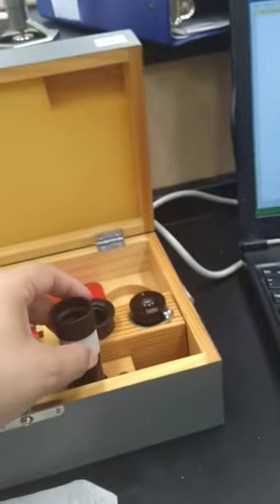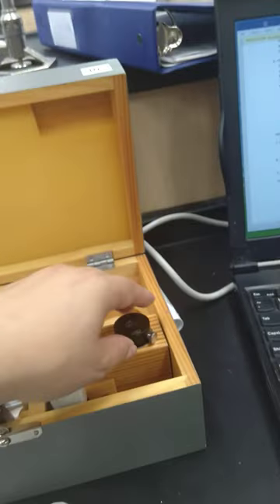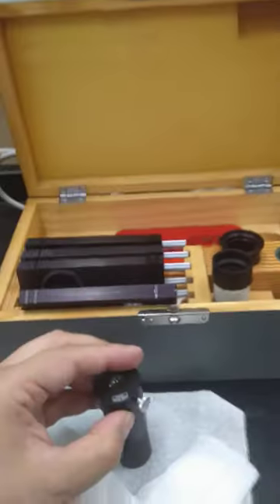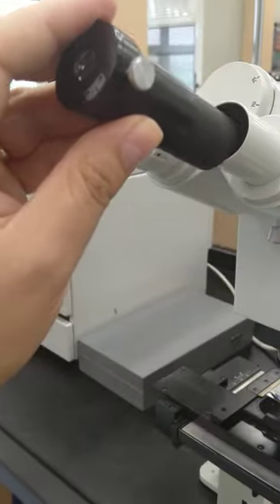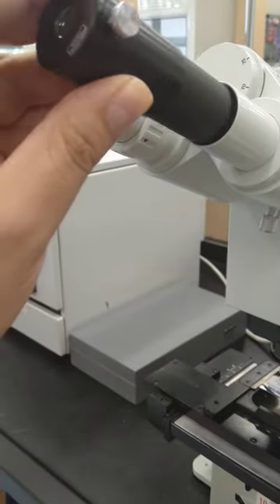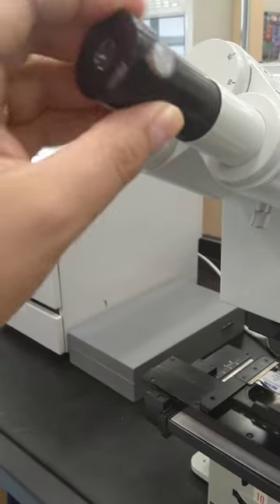Very carefully, you can put it here. Then you take this telescope and you can put this telescope inside here.